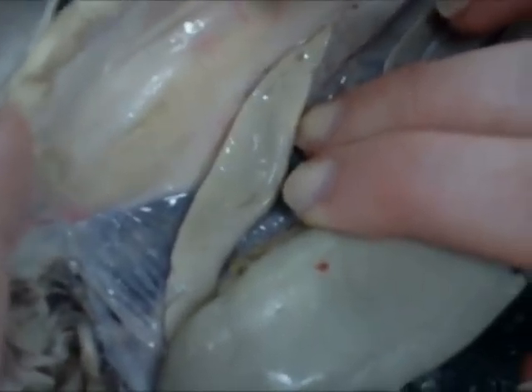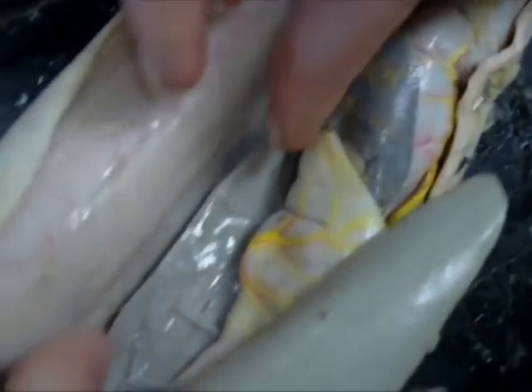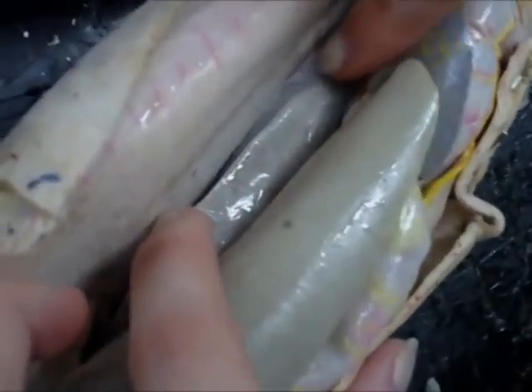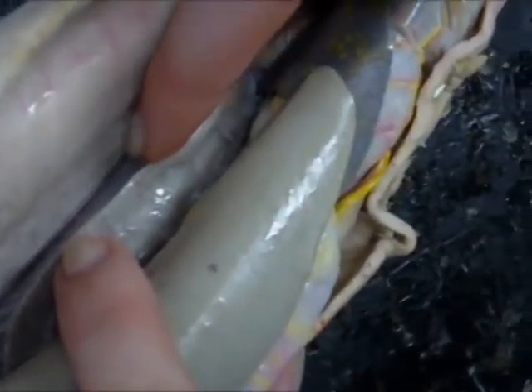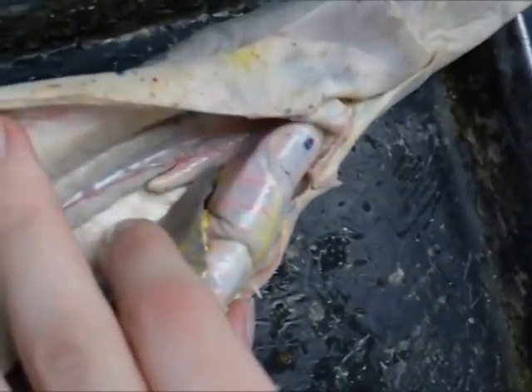So we've got an ovary here. This film you can kind of see is the mesentery. This is the mesogaster, and there's the mesocolon — the membrane in the back of the digitiform gland.